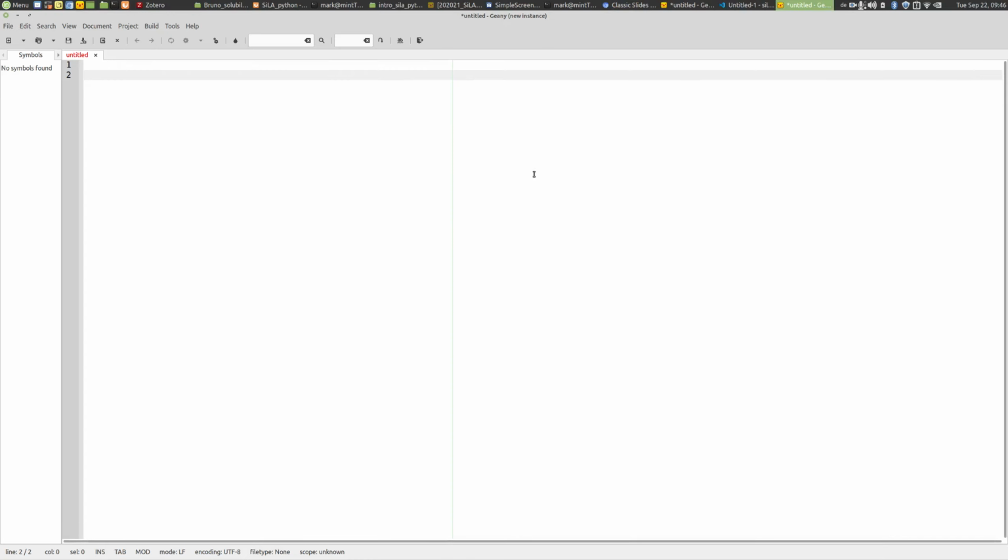So here's a plain text editor, so nothing fancy, just something like a Word notepad, and then you start drafting your feature. Let's make a simple example. Let's just specify a SiLA server for a thermal shaker. So you start writing down SiLA server design for a thermal shaker. This device should have two features.